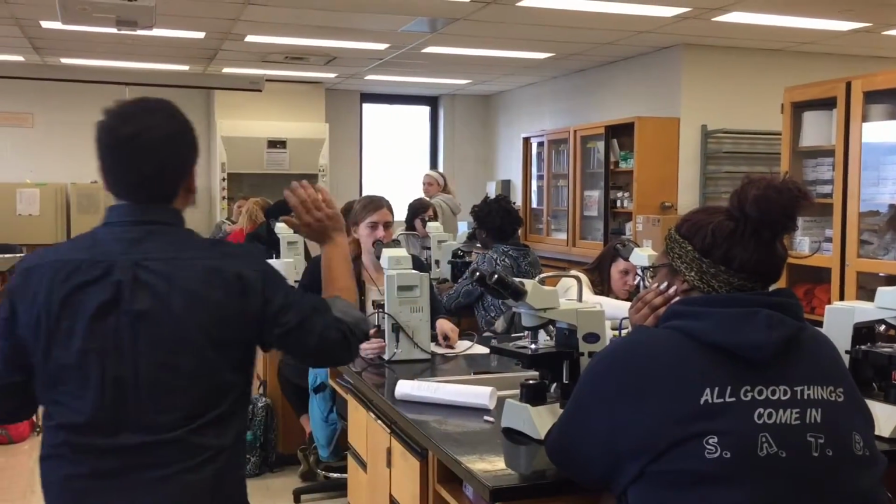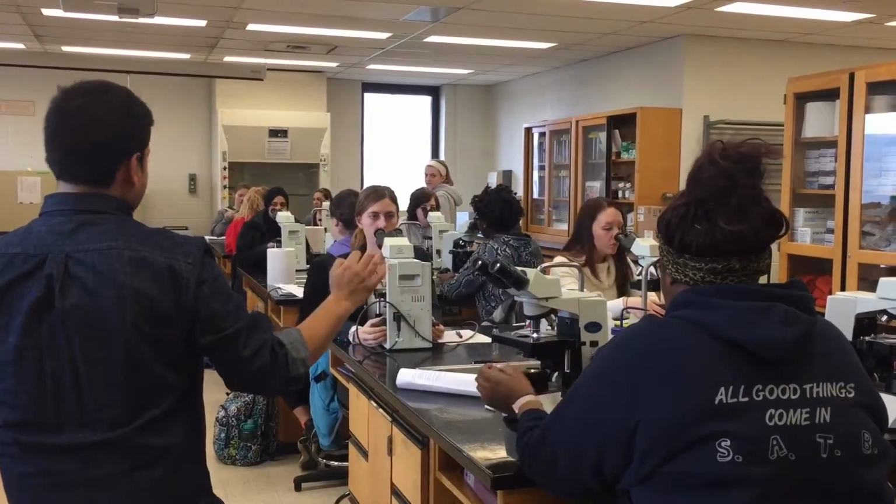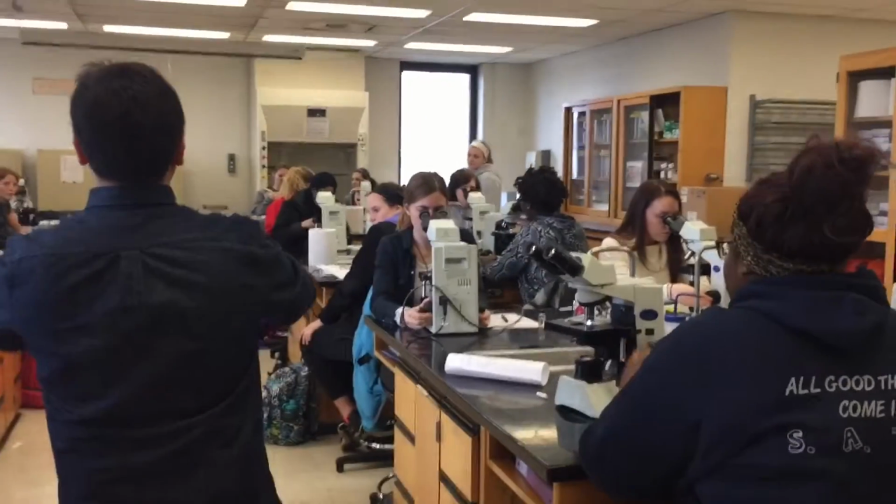Have a look. You guys are welcome to come and have a look at how it should look. At 100x, we should be able to see the shape of the bacteria clearly.